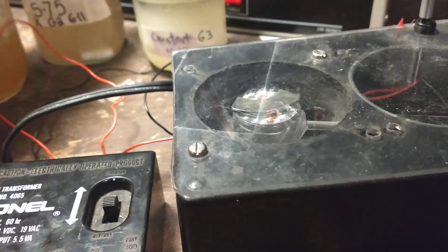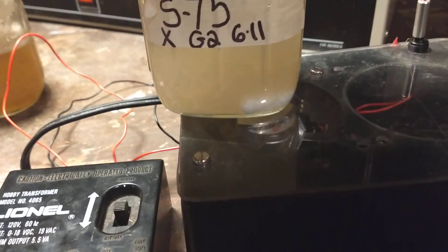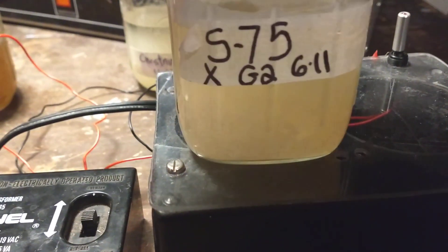I don't think you need a lot of space. Even with a square jar you can get the bar stuck there and it works fine.